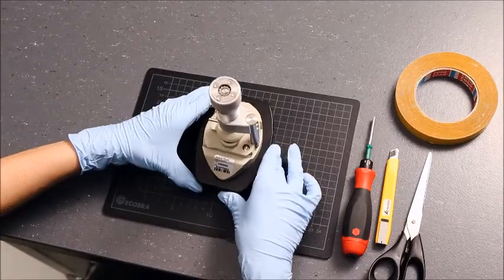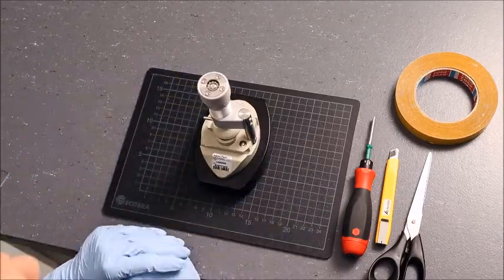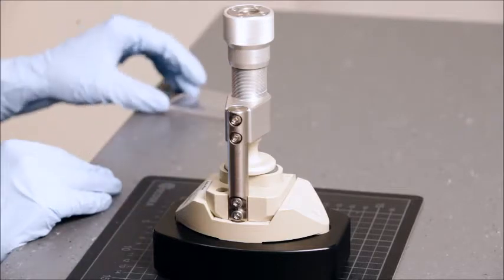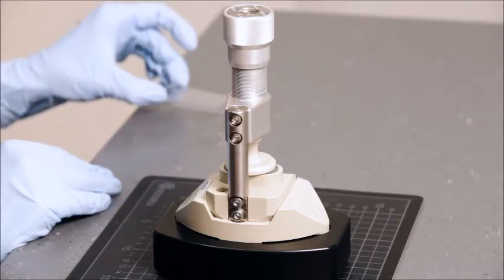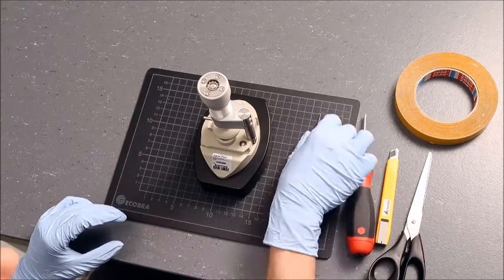This video shows you how to mount your sample in the clamping cell and how to mount the cell in SURPASS-3. We are going to mount a rigid polymer plate.